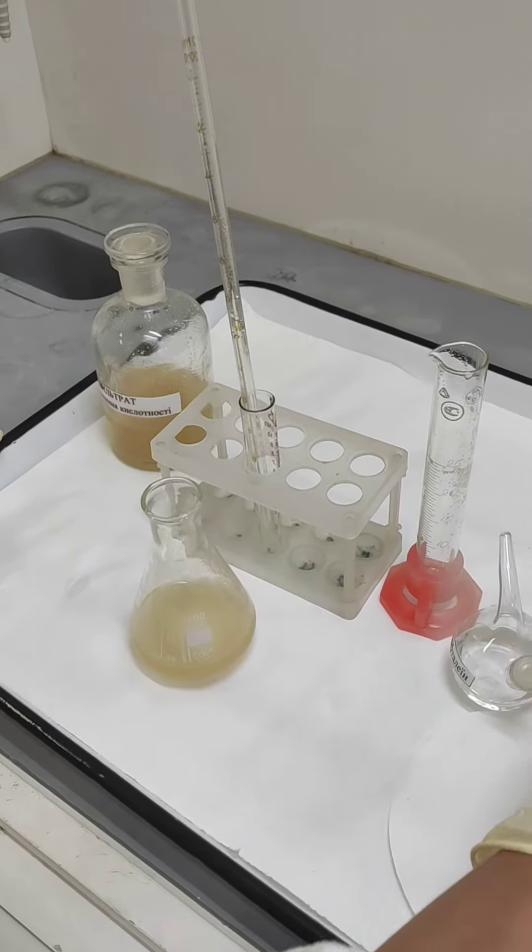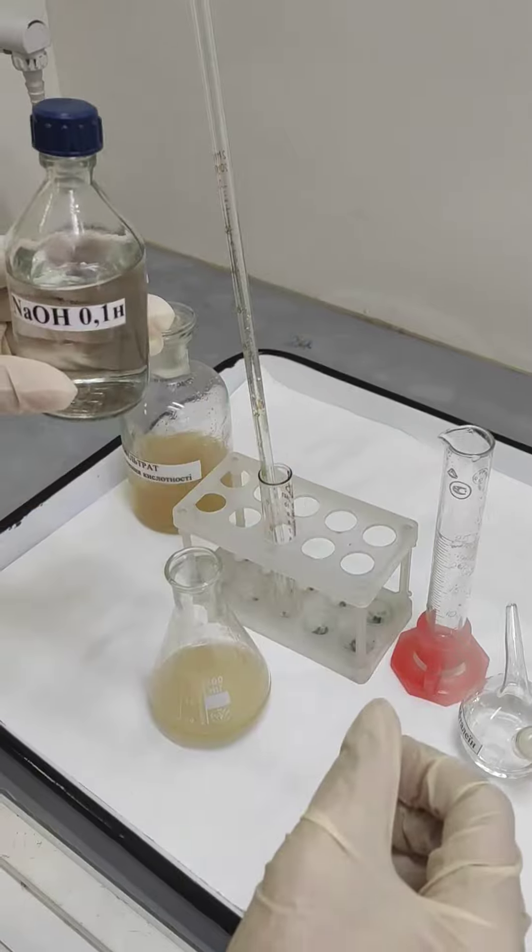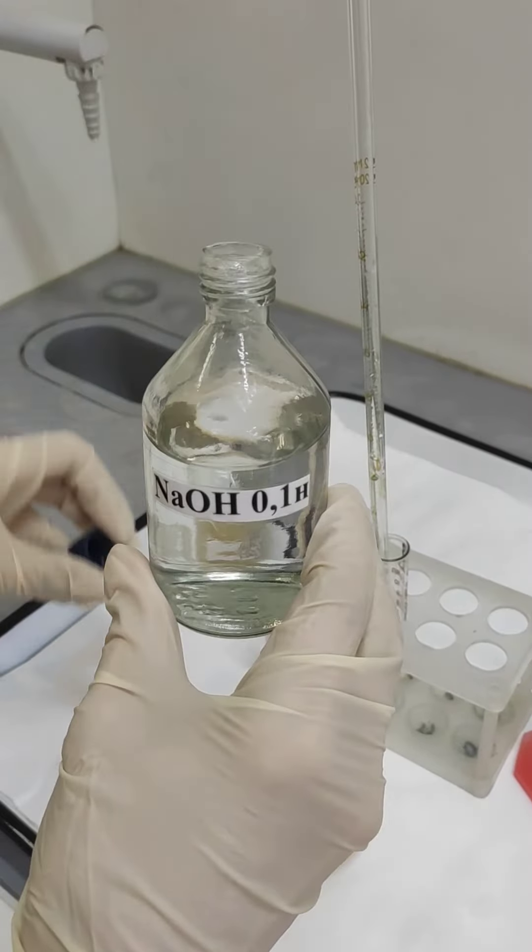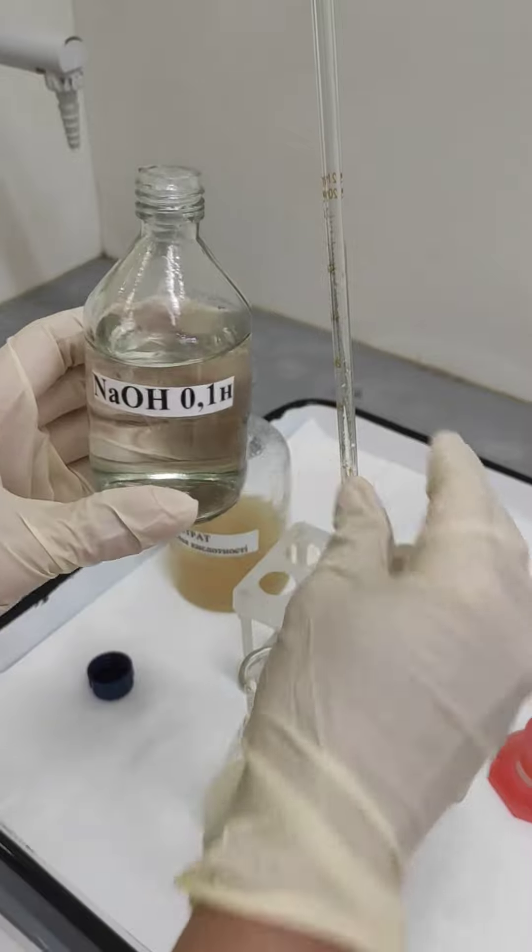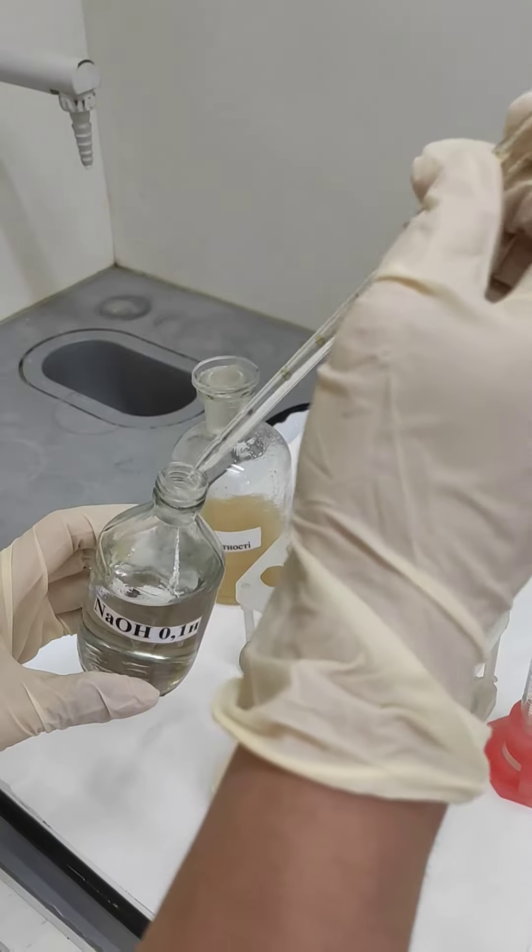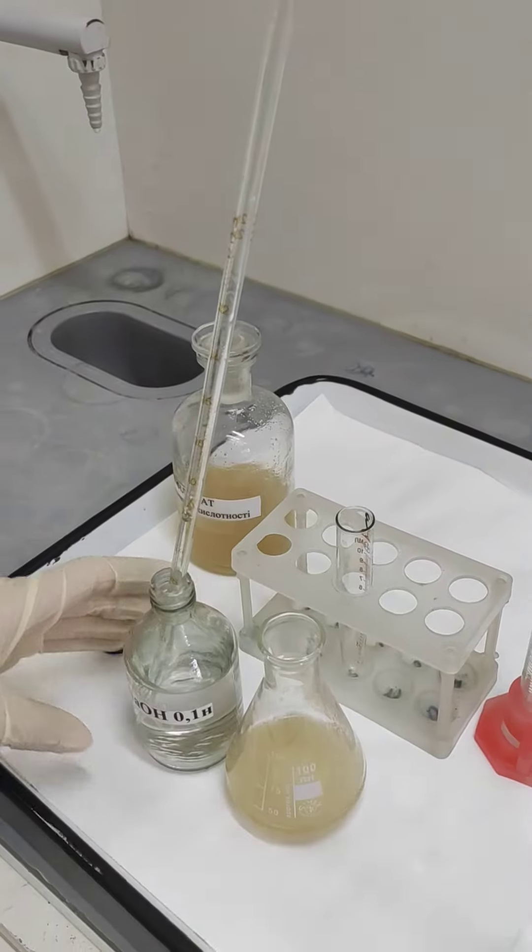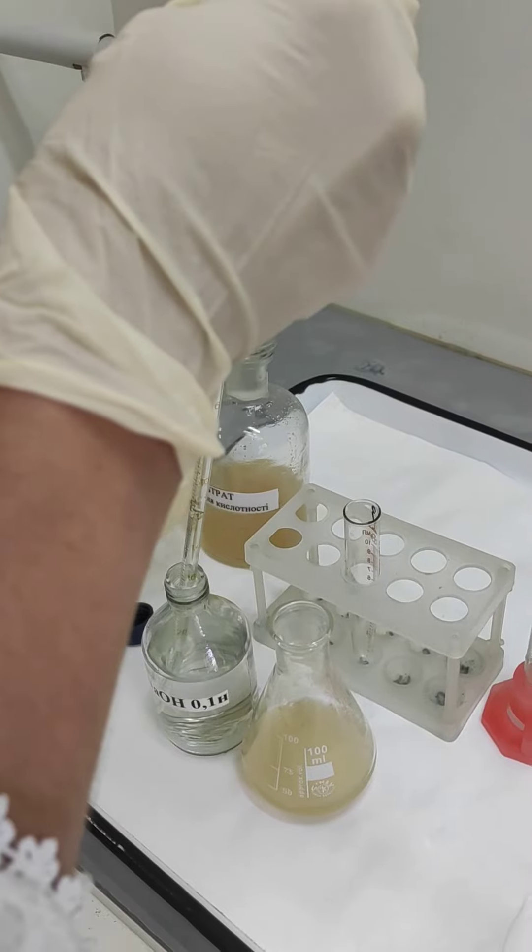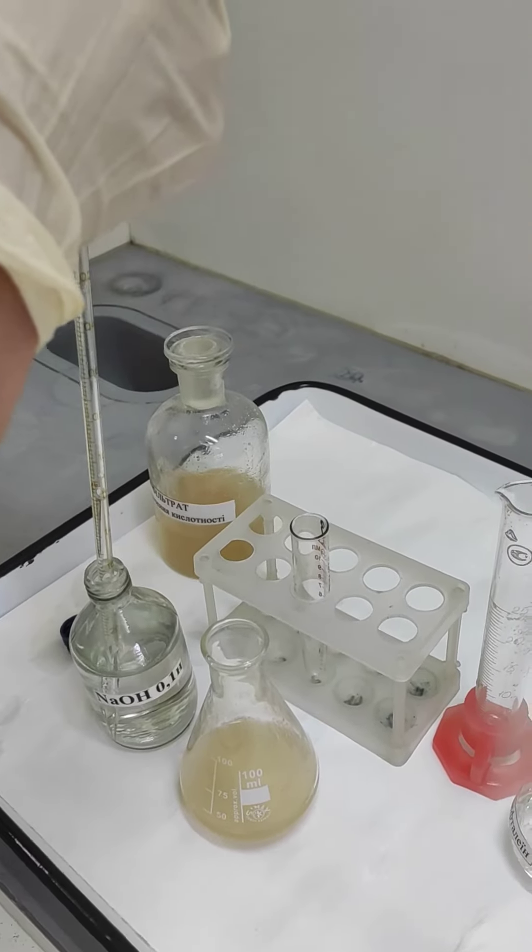Then, we take a small pipette glass with sodium hydroxide and titrate, adding drop by drop. We count the drops in this case, not milliliters.